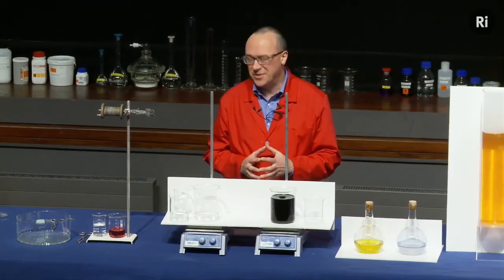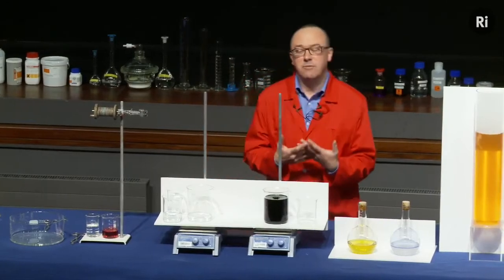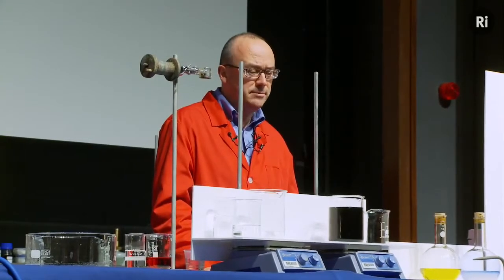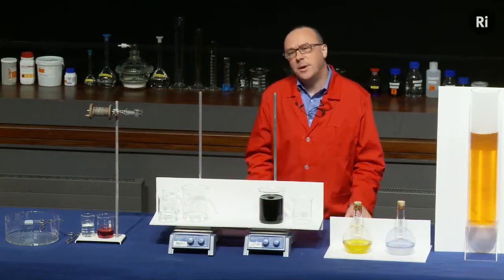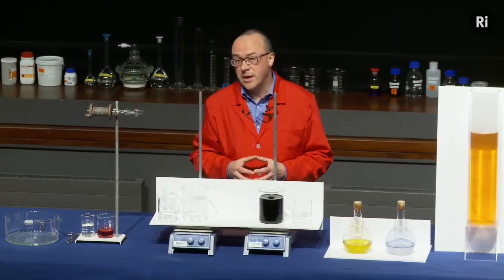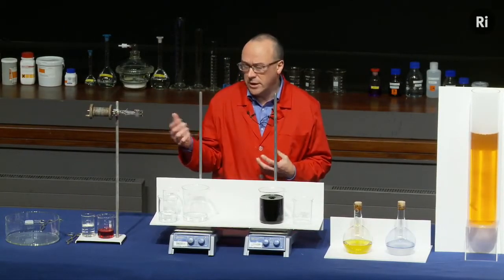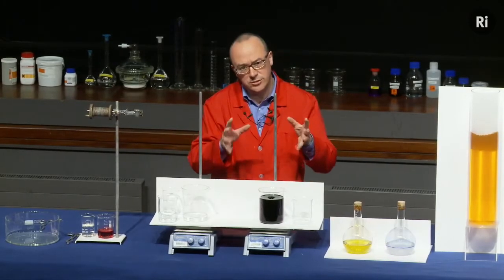Very strange indeed. We mixed the two chemicals and it seemed as if no reaction took place. It just sat there for 10 seconds and then suddenly it reacted. Now that seems very odd, very surprising. But what was really going on? What was really going on is that there were actually two different chemical reactions taking place inside this beaker. The first reaction was quite a slow reaction. It was a reaction between two chemicals that produced iodine.